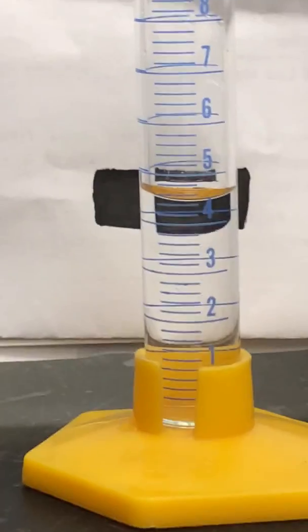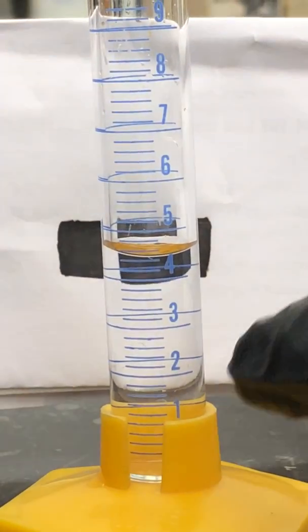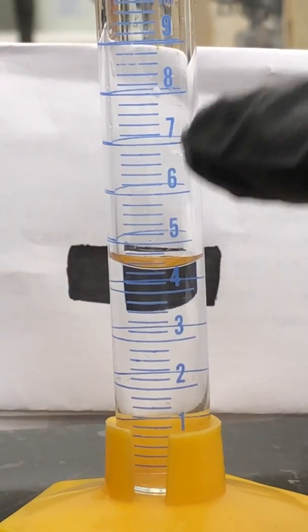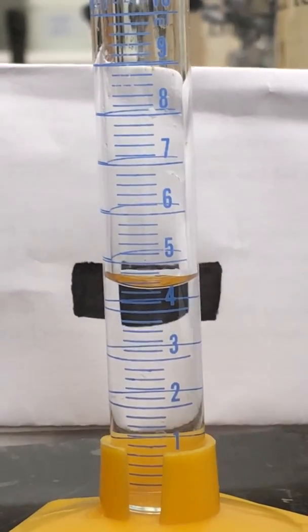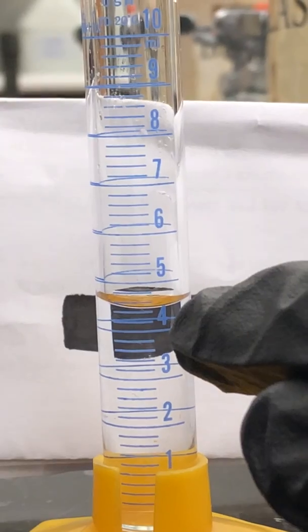Now we're going to measure. You'll see that each of the large lines represents about one milliliter, and the smaller lines represent 0.2 milliliters.